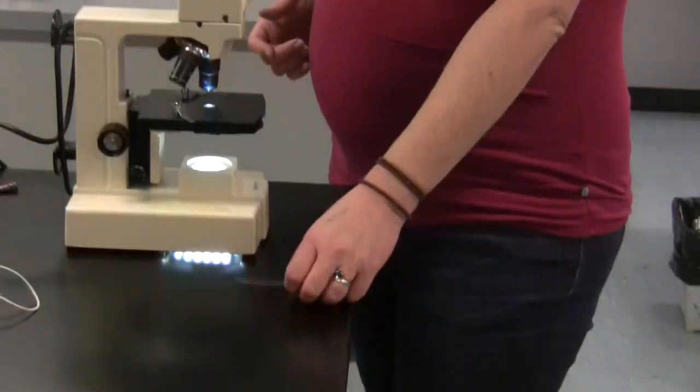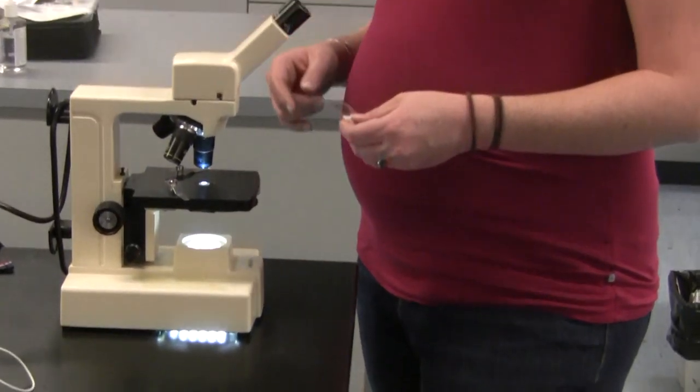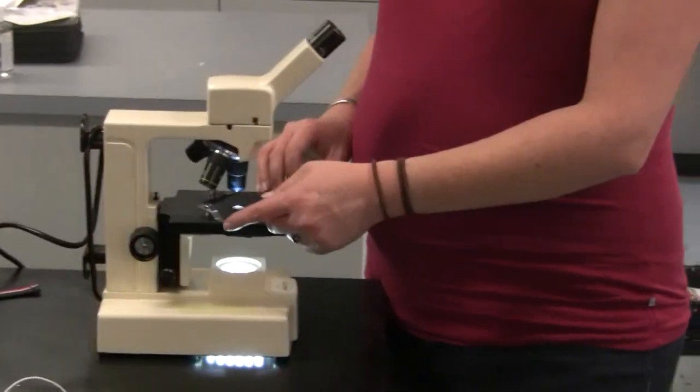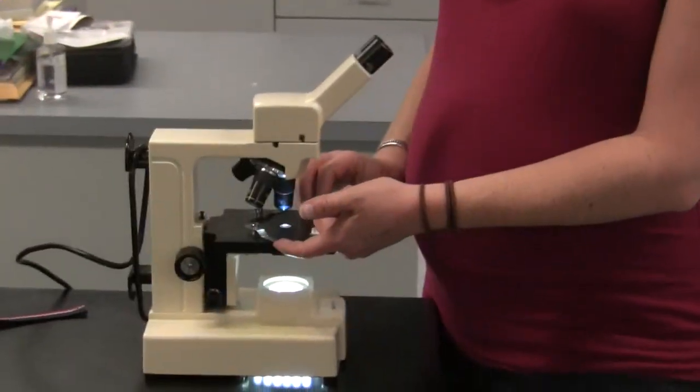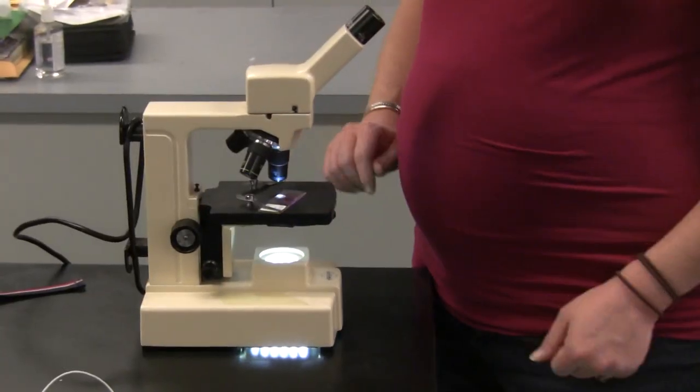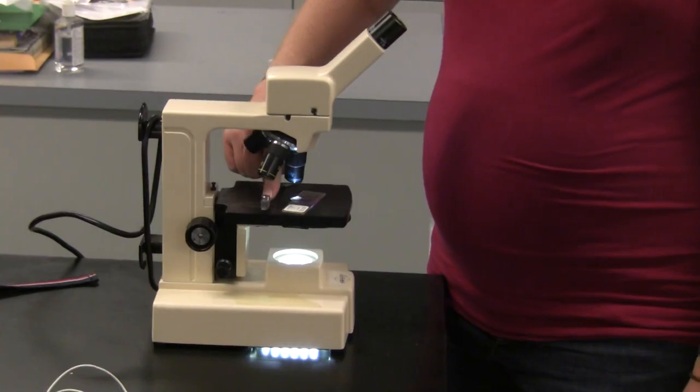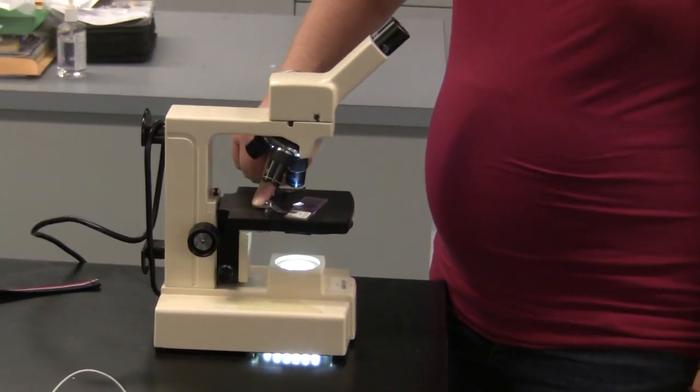Then it's time to place your slide on the stage. So you'll see there are these little clips. The clips, a lot of people just grab them by the bottom and put the slide under it, but here's something snazzy. The back of the clip, if you push on it, oh look, it goes up and you can move it around.